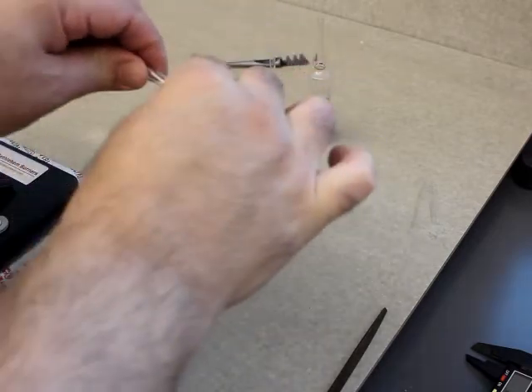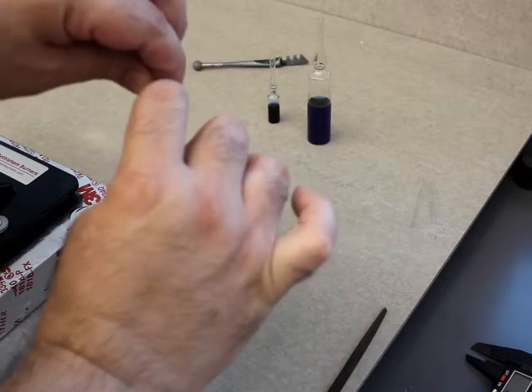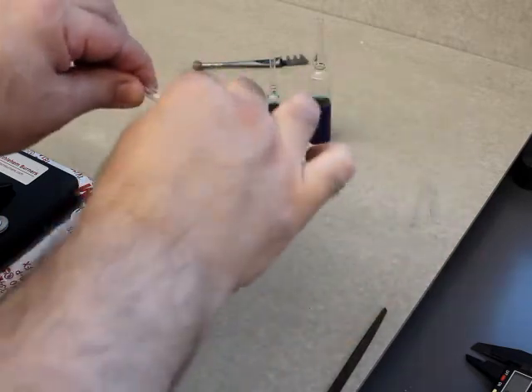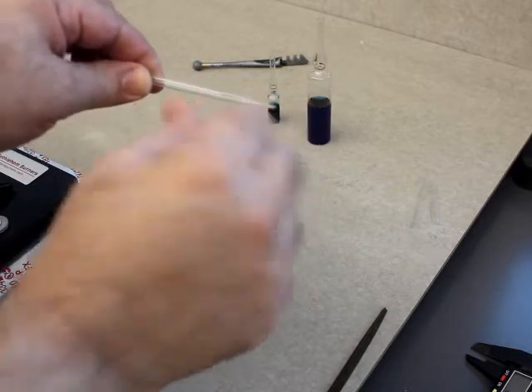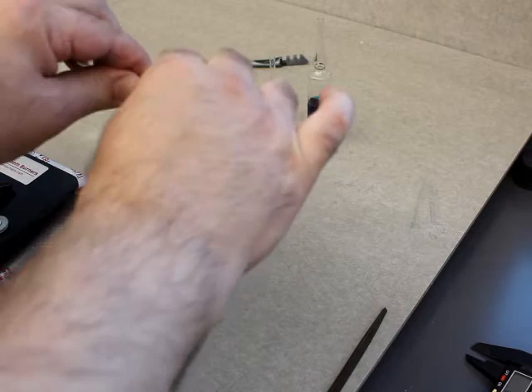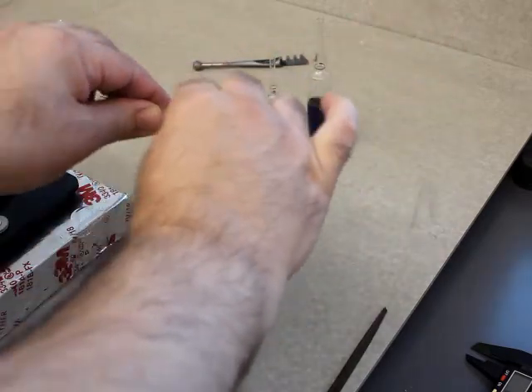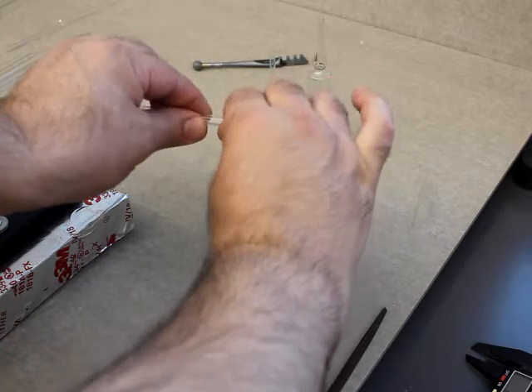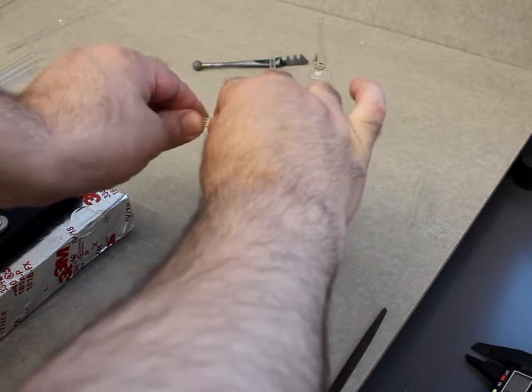I take this — there's the scratch right here — and I can actually feel it with my fingernail. I take it, I turn it away from me. I have to be careful since the tip is broken — that's actually sharp glass. So the last thing I want is to focus on this and then jam the other part into my hand. I got it away from me and give it a little bit of pressure.